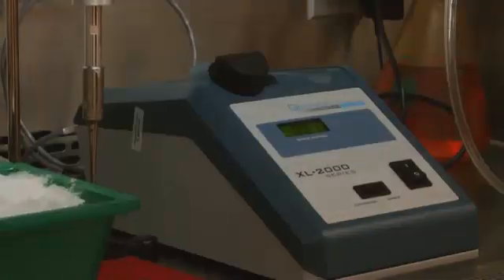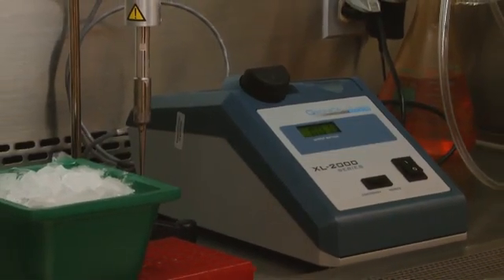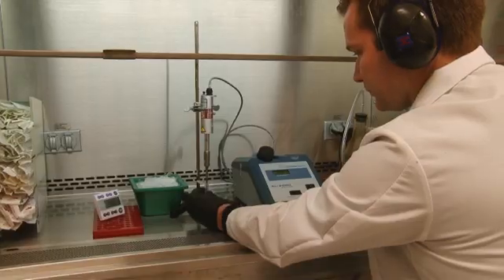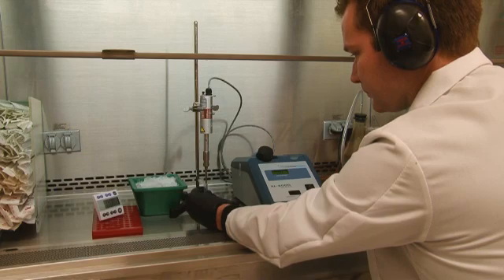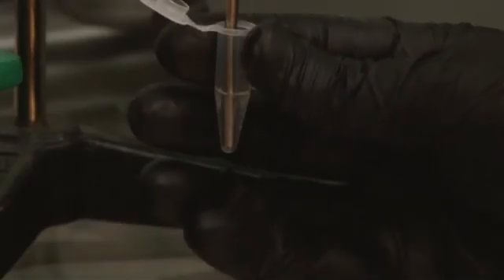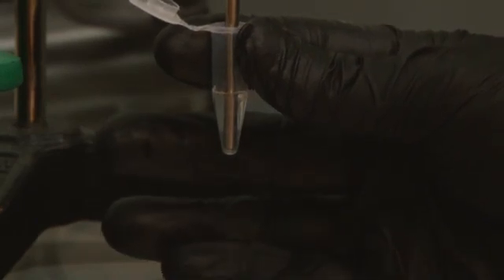However, there are several general tips for successful DNA shearing. First, keep the Sonicator tip close to the bottom of the tube and limit the volume to 400 microliters.